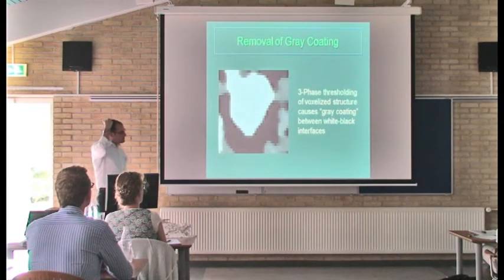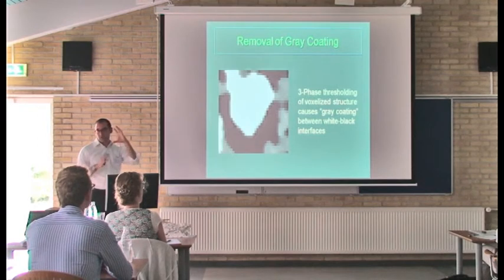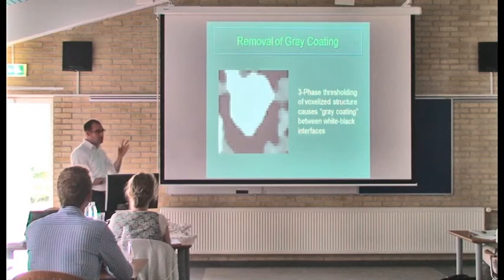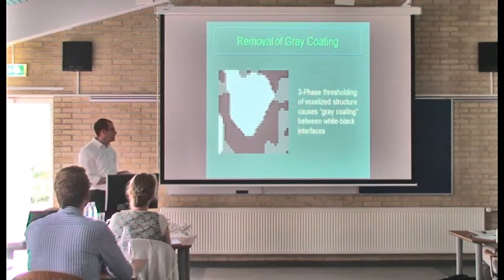So this is another issue we kind of found out quickly when dealing with a voxelized structure in 3 phases. Anytime you do any sort of thresholding, when you have an interface between a white phase and a black phase, invariably, so here's a white particle and here's a black pore, and you've got this interface. Invariably, you've got this gradient across here, and there's going to be gray voxels there. So this effect that you see when you do a double threshold is that basically a lot of these white particles get coated with this gray coating, for no better word for it.